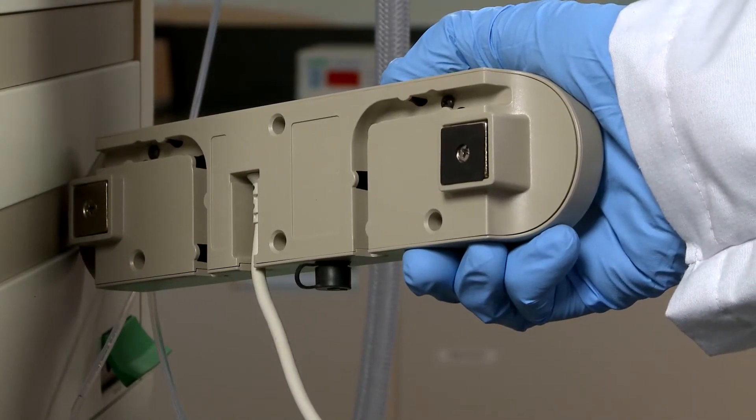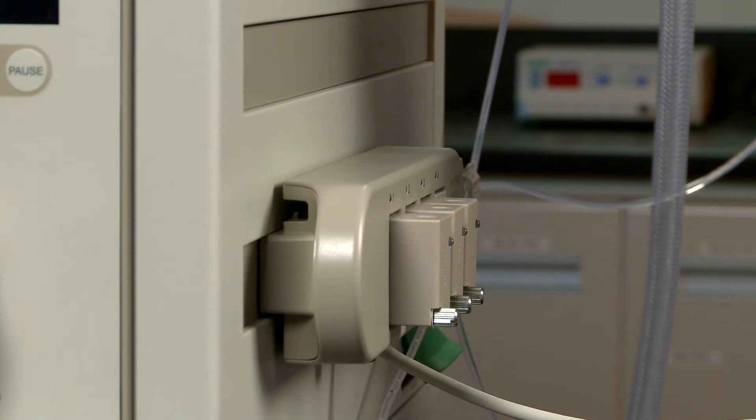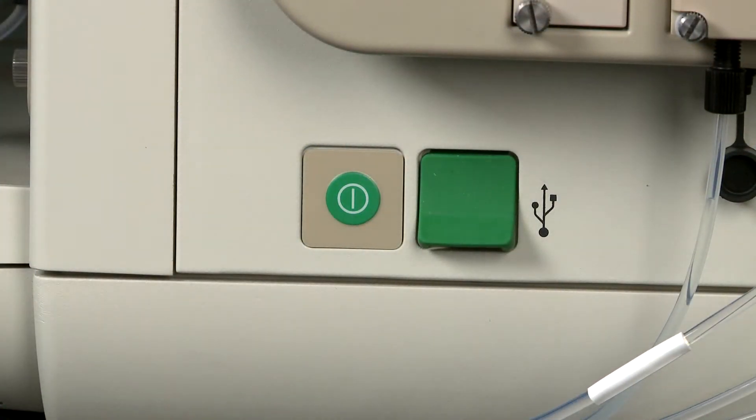Air sensor modules are attached to the front or side panels using magnets. Before connecting a module, turn off the power to the NGC system.